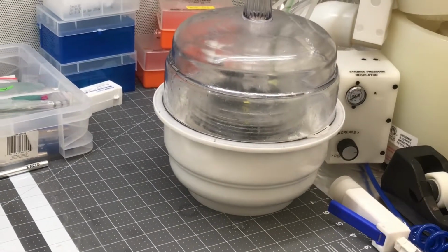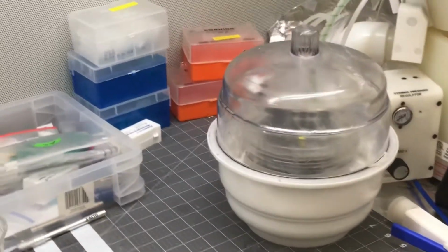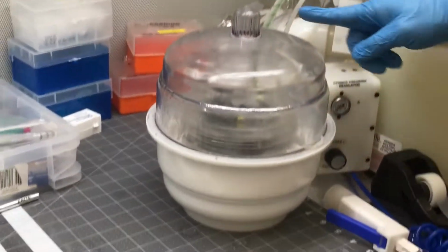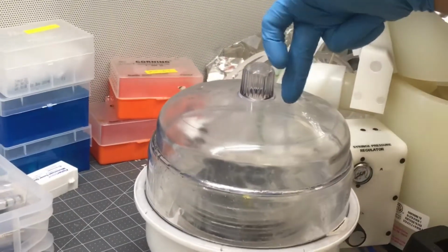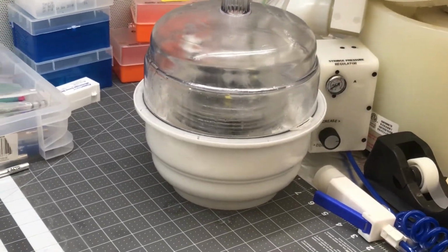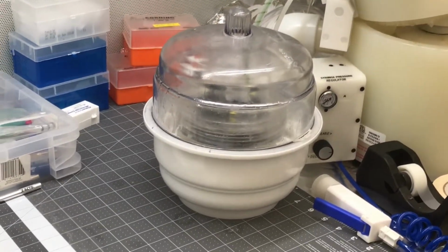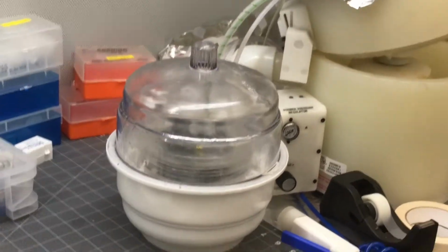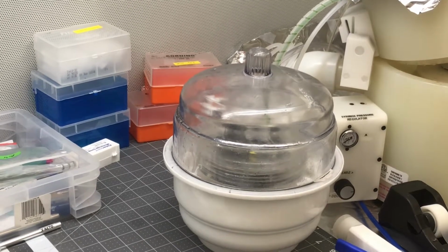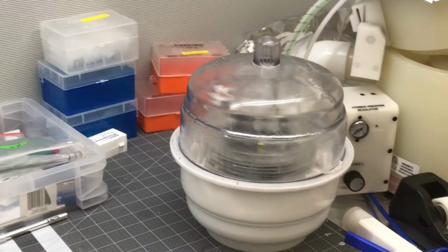When you put this in, to the naked eye it doesn't show bubbles. After you put it in the vacuum, it starts to show the bubbles. Even now, if you wait, you can see there is still some part with no bubble, but after some time the whole surface is covered with bubbles. It means the bubbles go up from the bottom. So this takes about 10 to 15 minutes.